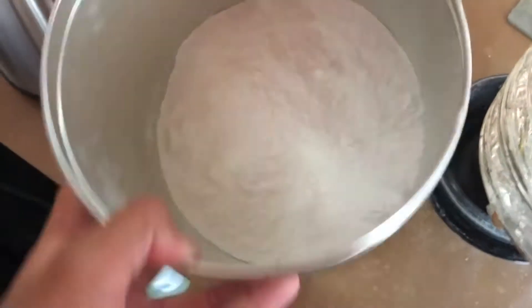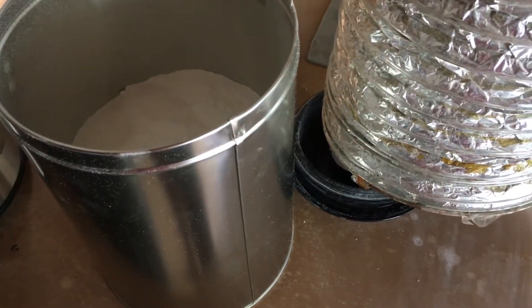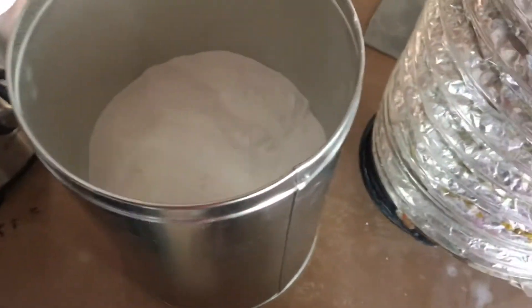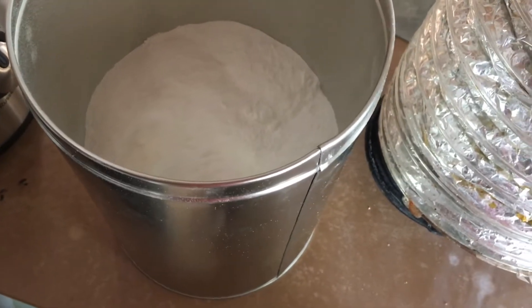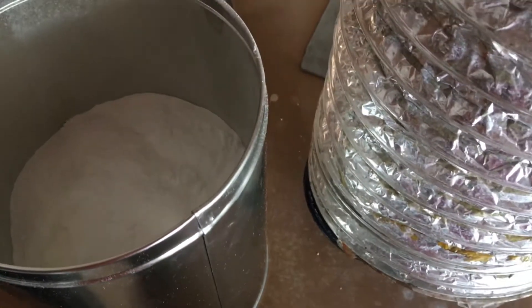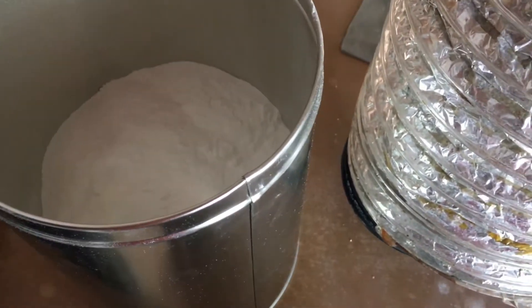So this is already about halfway full. What I'm going to do is add a little bit more sodium hydroxide — actually I might just add the rest. In theory, since it's at 100% yield, I should get roughly 619 milliliters of benzene.